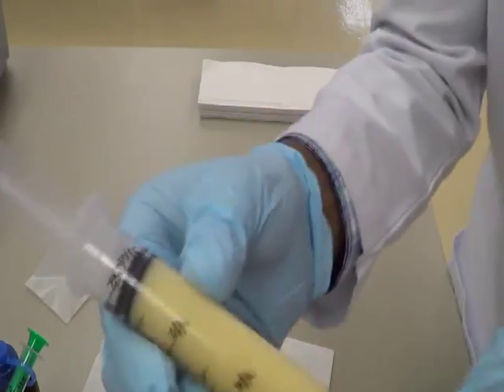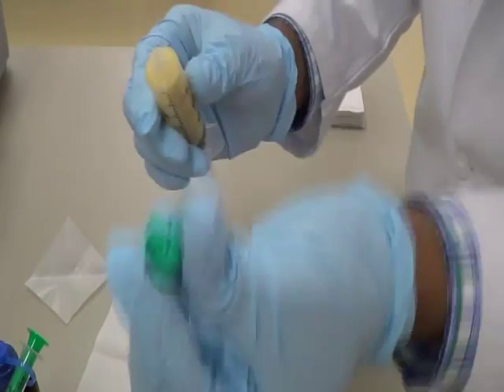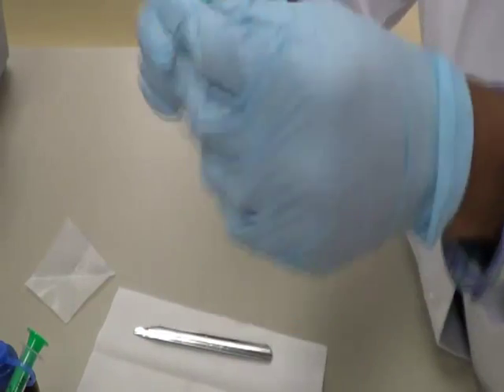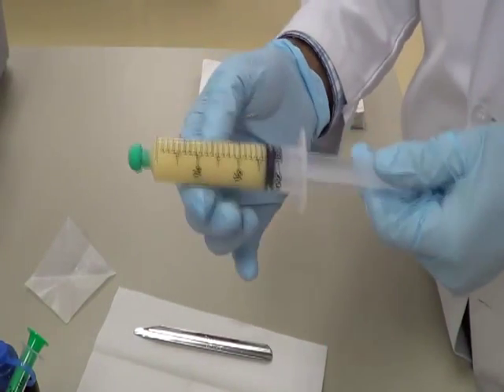That is it. So we are done with the gel. And now we have a nice gel. And what we are going to do is we are going to connect this Luer tip back again to the syringe. And label it and dispense it.